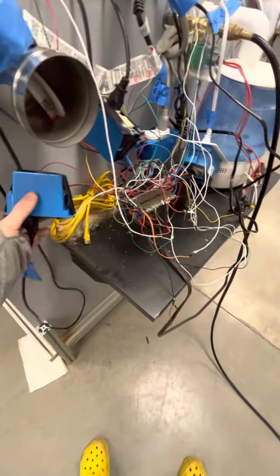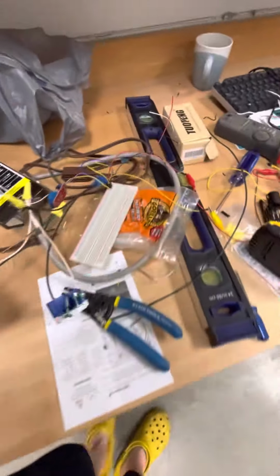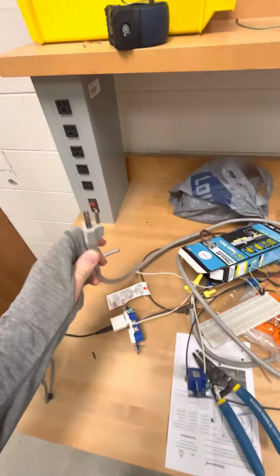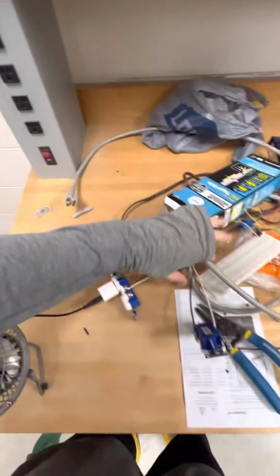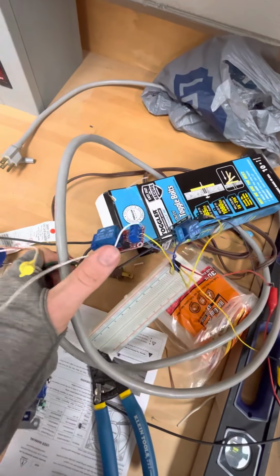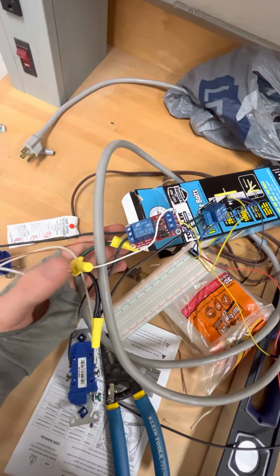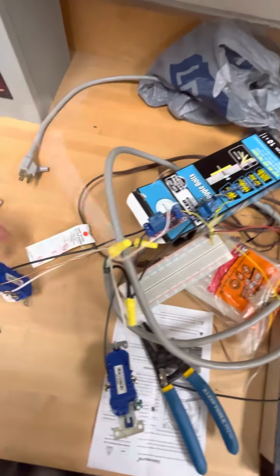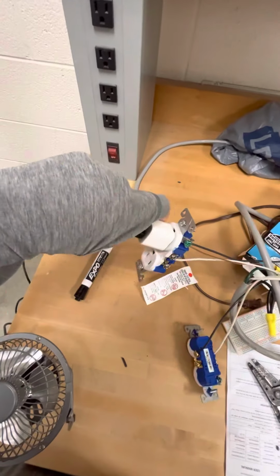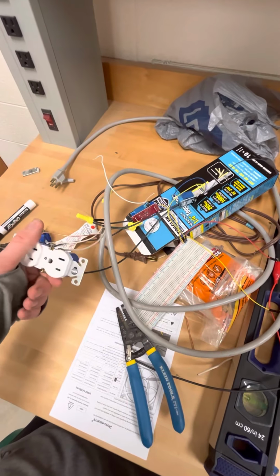How we actually are controlling the appliances is interesting. We have an electrical outlet I can actually show you over here, where it's going into a relay. So what's happening is we got mains power coming in here. So that just plugs into any of these outlets. And then we've got the live wire going into this relay. And whenever this 5-volt signal from the Arduino activates it, it passes the live electricity from the mains through this, completing the circuit on the outlet. And you can just plug whatever you want into this. And we just have 5 of these controlling 6 appliances.